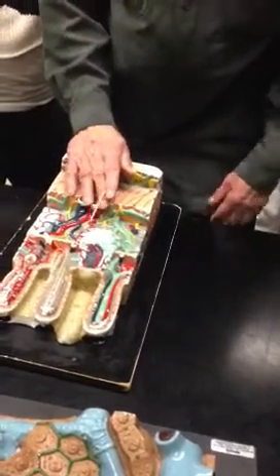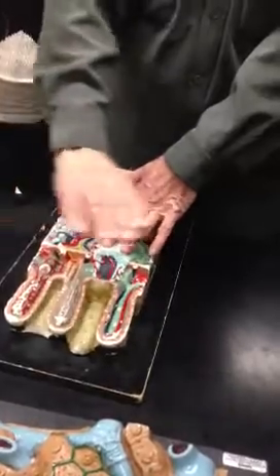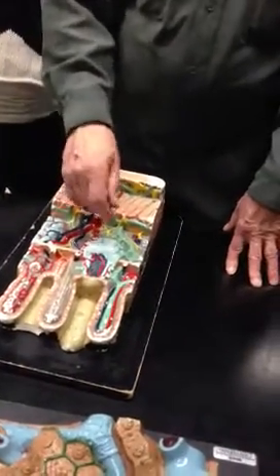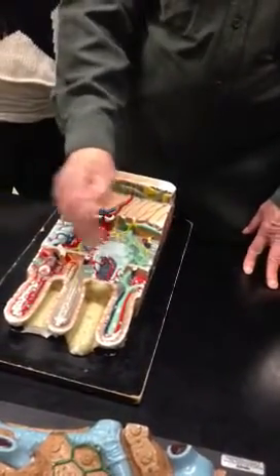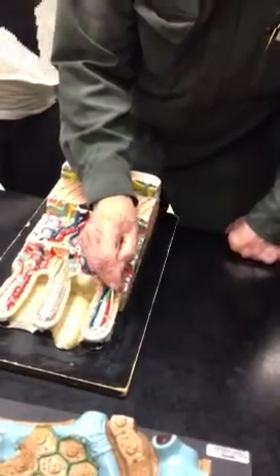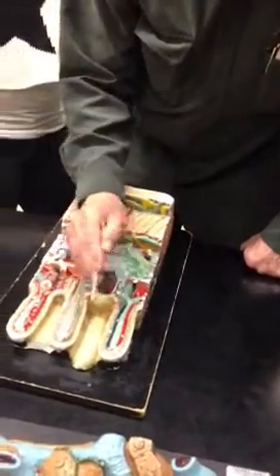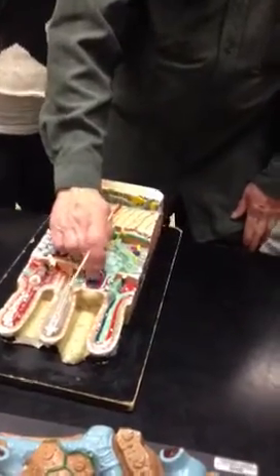So, of course, it's not surprising that an area that's going to be richly supplied with bacteria, which could injure us, is going to have a lot of protective elements present. So besides the Paneth cells, we've got these lymphocytes. And the lymphocytes move away from here. You know, they wander. So here, you see, is a little purple cell. Here's a little purple cell. These little purple cells, which you see here and there, are wandering lymphocytes, which are wandering away from here.